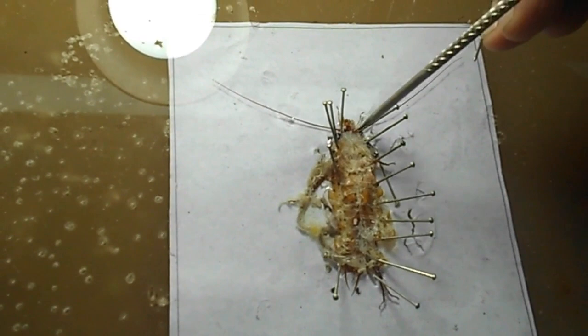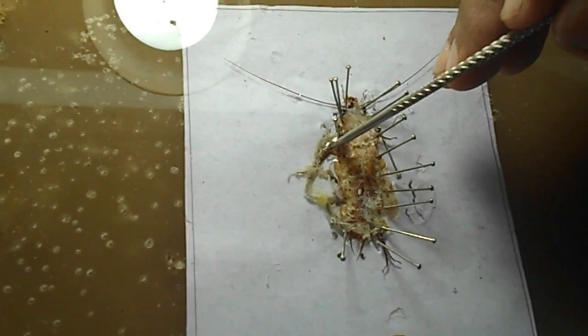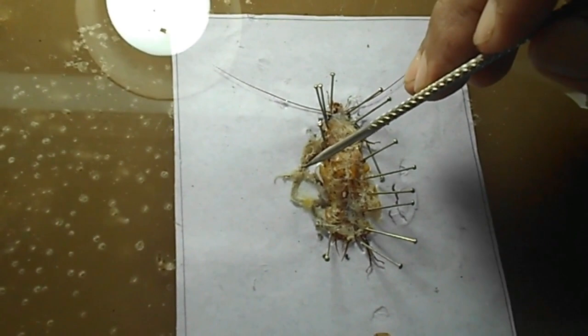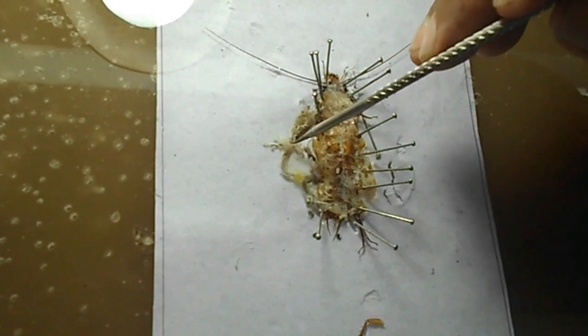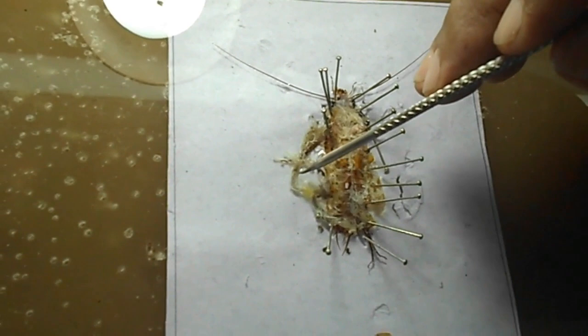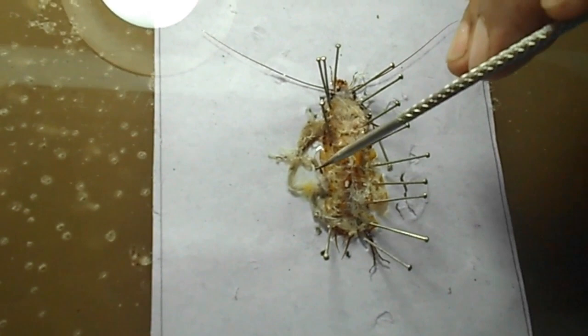This is the preoral cavity or mouth. From there, first the pharynx, then the esophagus. This bulging structure is the crop. This muscular spherical structure is the gizzard. Here you can see a few finger-like projections — eight finger-like projections — called hepatic caeca. After the hepatic caeca, this tube-like structure is called the midgut. Here we see some green color projections — these finger-like projections are called Malpighian tubules, the main excretory organ of insects, attached with the digestive tract.